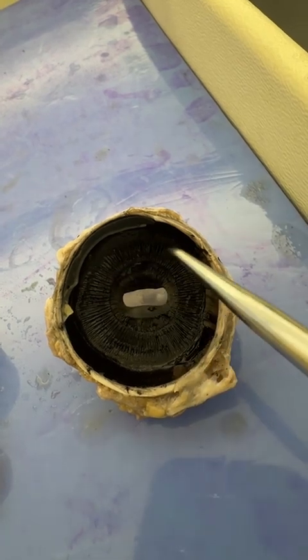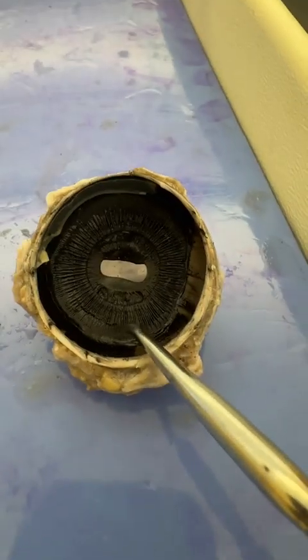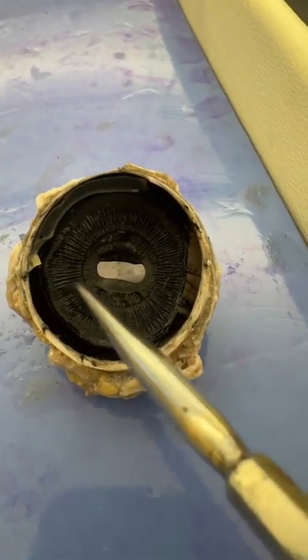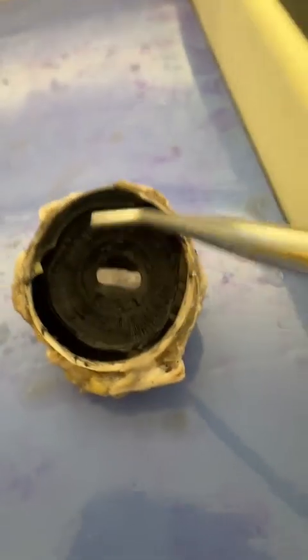All right, bottom of the mushroom, these little stripes. It looks like the gills on the bottom of mushrooms. Those are called the ciliary body. They're going to be pulling on this little ball, the lens. So after death, this thing's hard, but it is a little more flexible in the living.